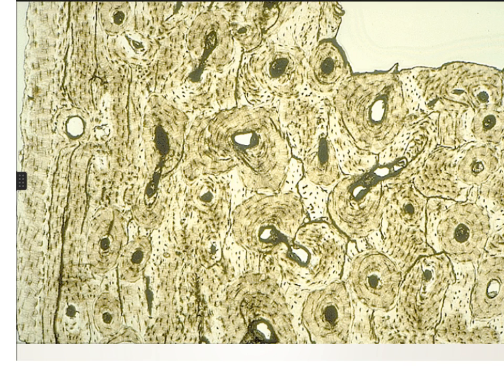This picture is unstained, and it is very light yellow in color. So this is the section of the ground compact bone. You should mention two points in this identification: the method of preparation, which is the grinding method, and that this method does not involve any fixation or staining. So by this method you can only see the calcified tissue in the bone, and you never see living cells.